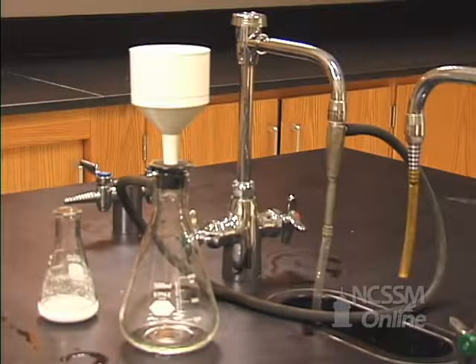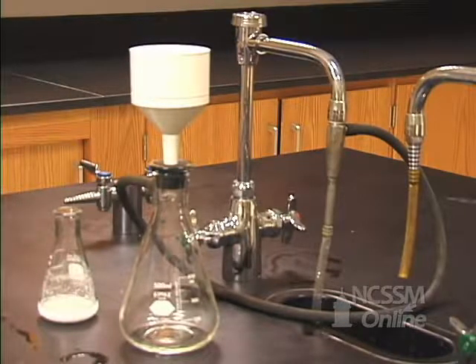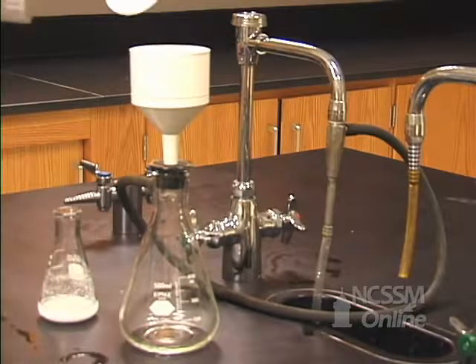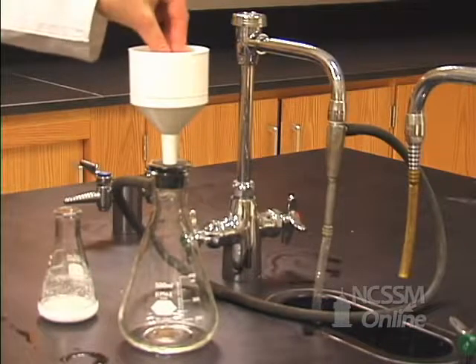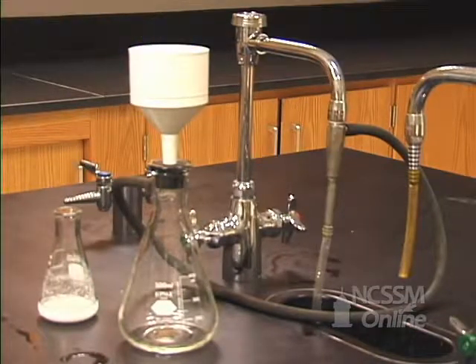The aspirator creates a low pressure inside our container here, and that will help gravity pull that water out and leave our aspirin inside the funnel. We need to put a piece of filter paper inside our funnel.